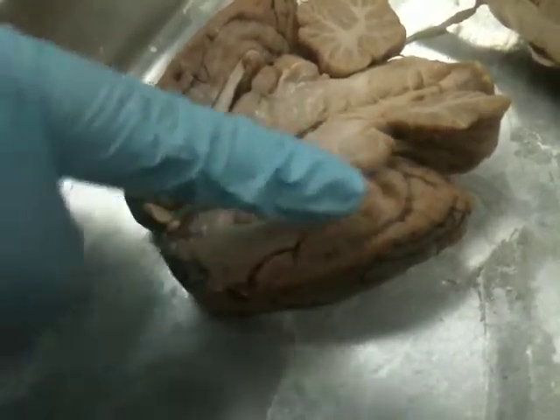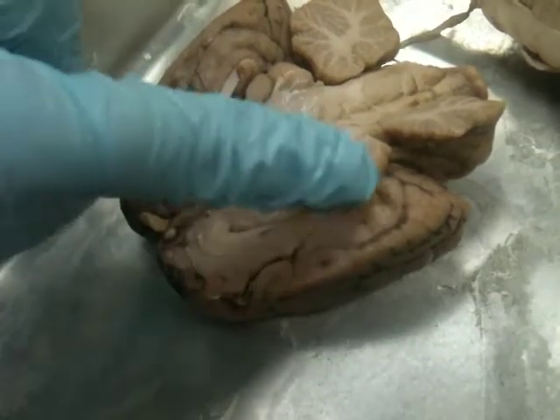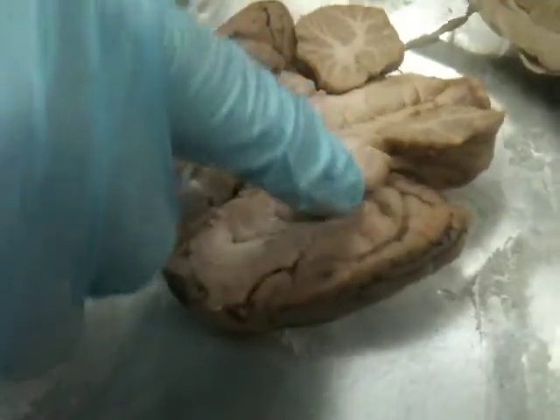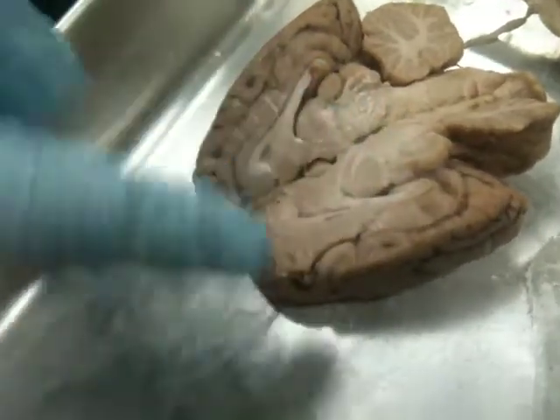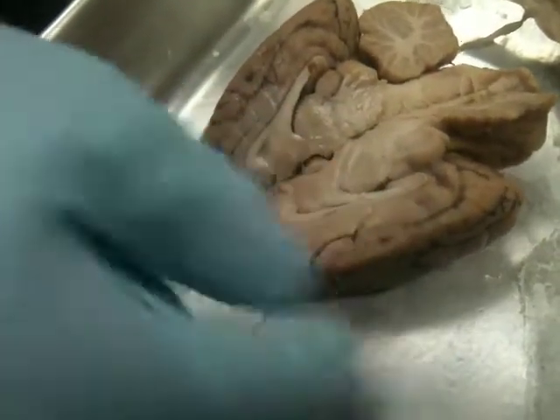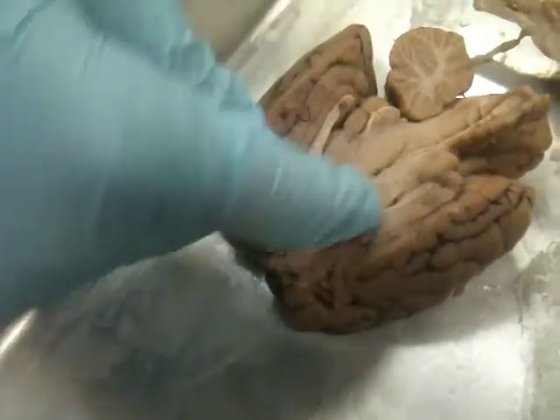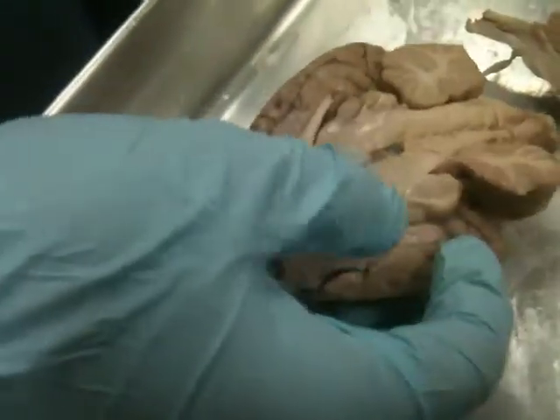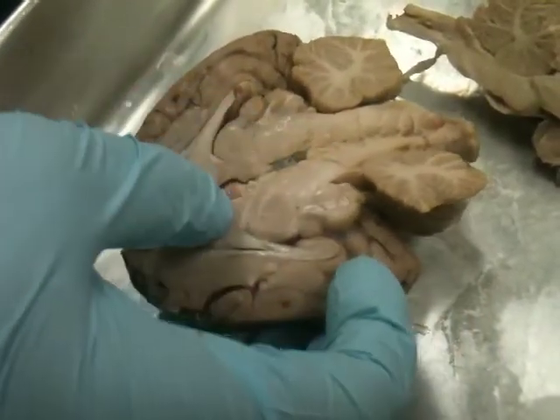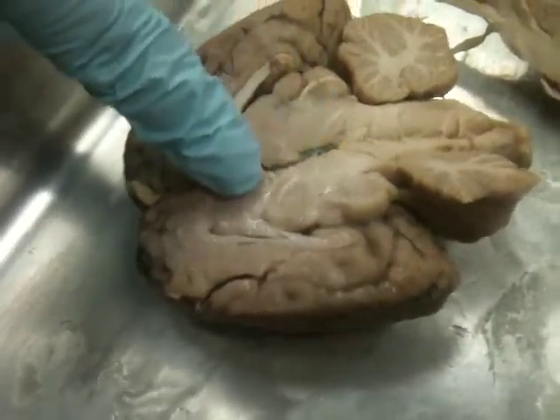Okay, then you have this region that's sort of above the thalamus, sort of including the lateral ventricle. What's the region above the thalamus called, do you think? In this case, it's what? Look at your handout. Sort of. This is the corpus callosum above the lateral ventricle. Then you have the lateral ventricle, and then you have the epithalamus, which is just the area around and above it. And then you have this area here, that's the hypothalamus. Where is it? This area below the thalamus is the hypothalamus.